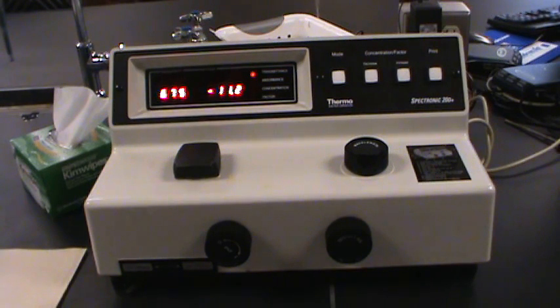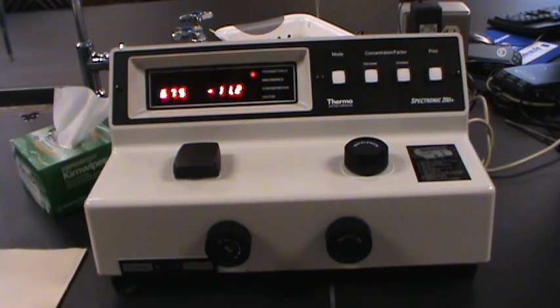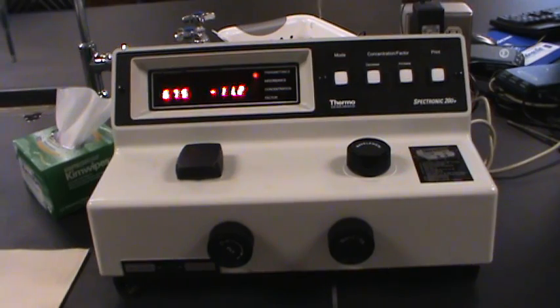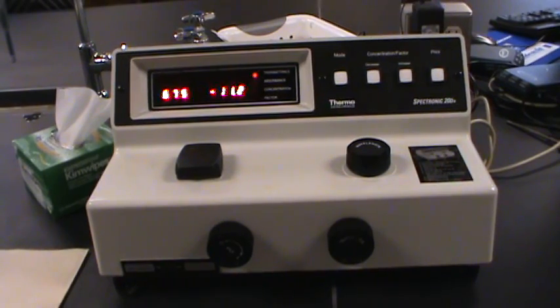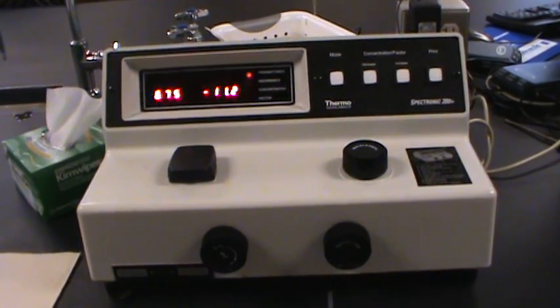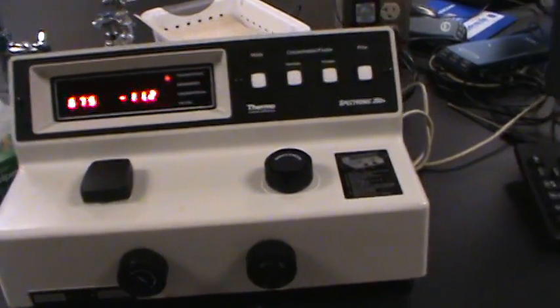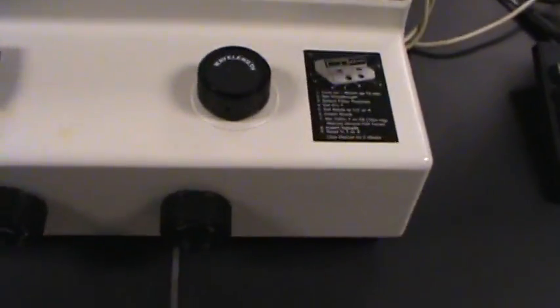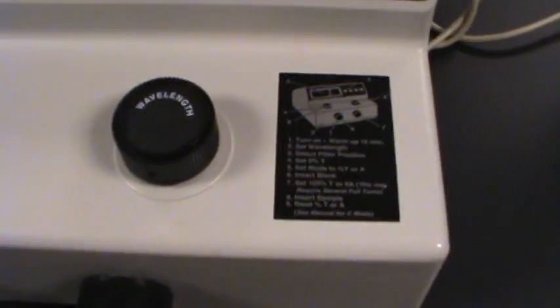So first of all I said we're going to take a look at calibration. So let's take a quick look at the calibration panel that's on the instrument.